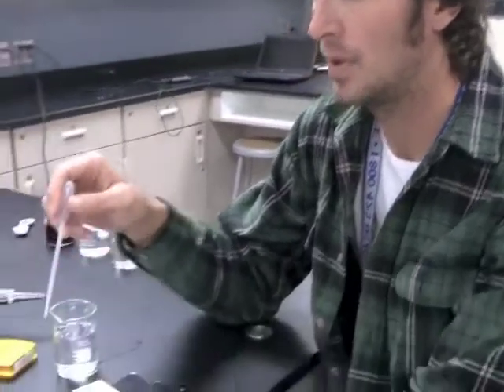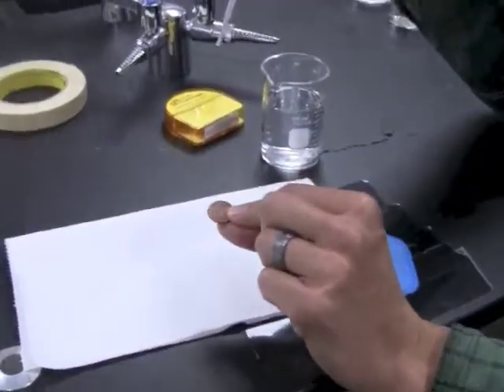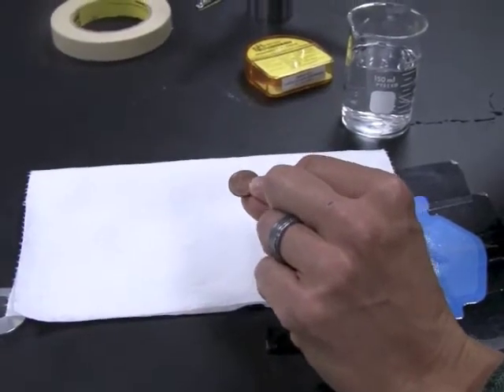Remember, everybody, we talked about how water is polar in nature. It has covalent bonds between the oxygen and the hydrogens, and because of this, it gives water a couple of special properties. Two of them are adhesion and cohesion. And we're going to demonstrate those by looking at how many drops of water we can put on a head side of a penny and a tail side of a penny.